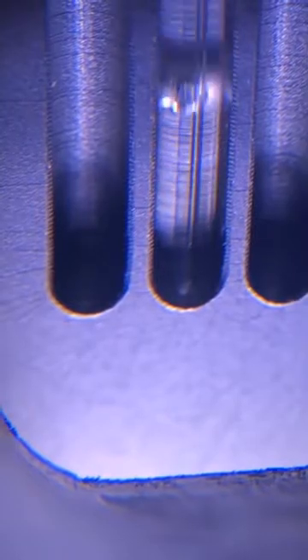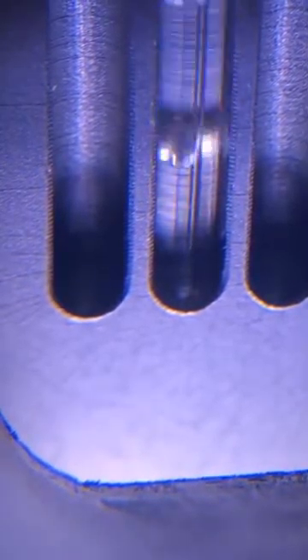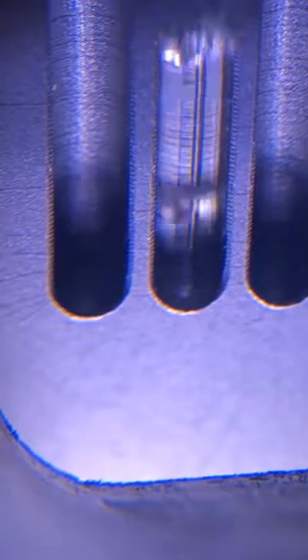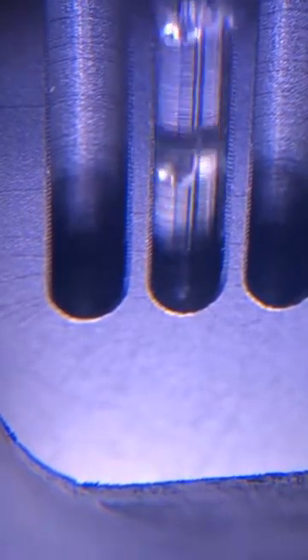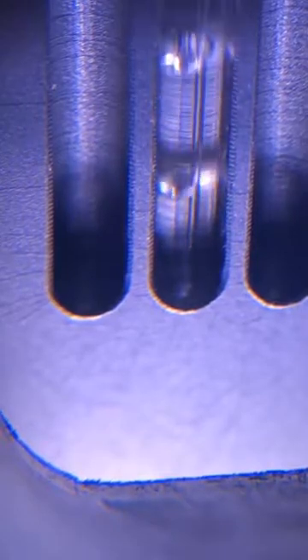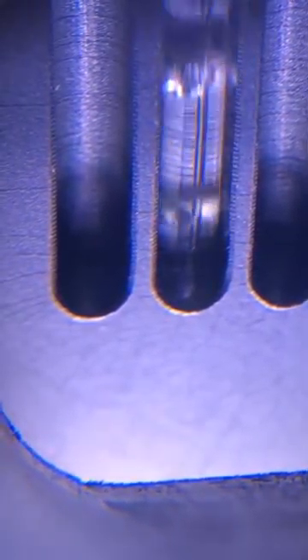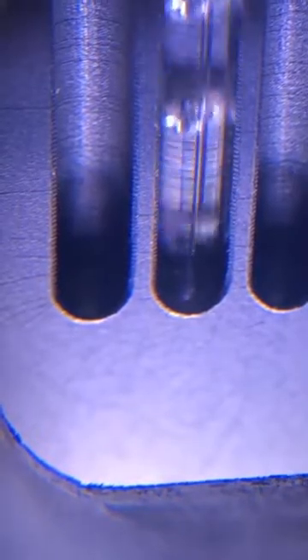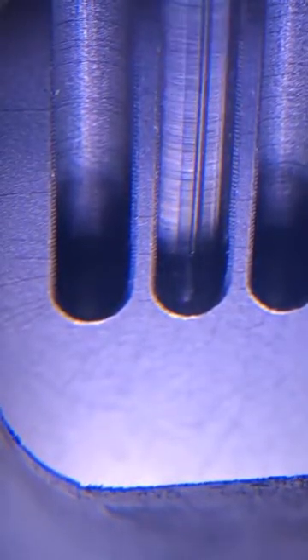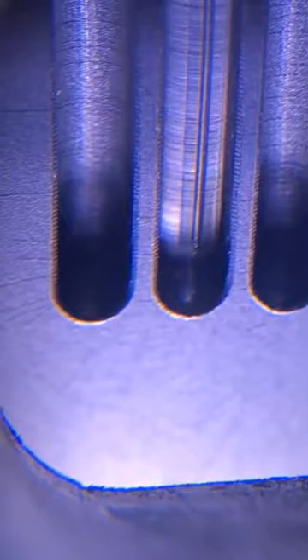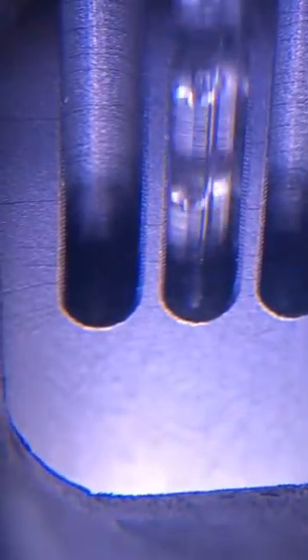Picking up a little now, but again, that's just vapor pressure increase. Remember, vapor pressures don't increase linear with temperature. They're exponential. So we're at 108 right now. I kind of think what's going on is you get this rapid expansion. Then it'll pause for a while as either the temperature is changing slightly differently or you've displaced the air. We're at 108.7.